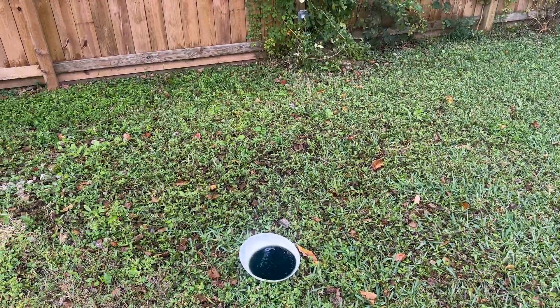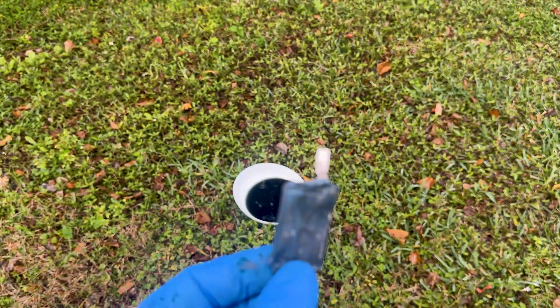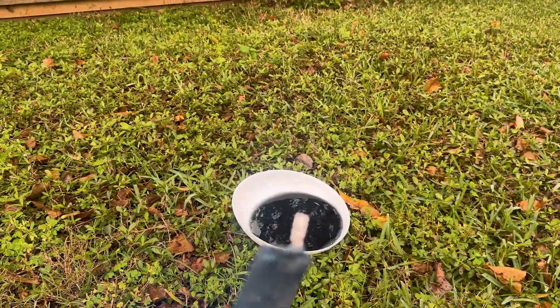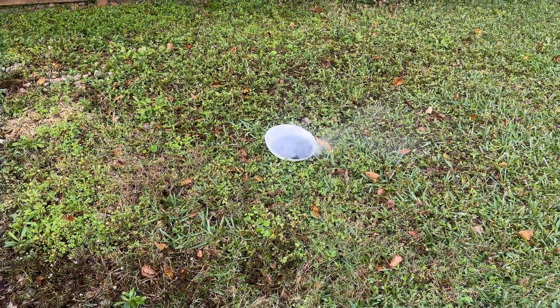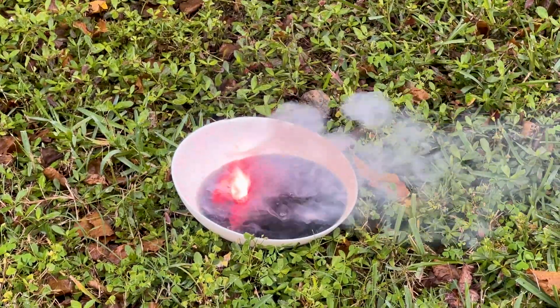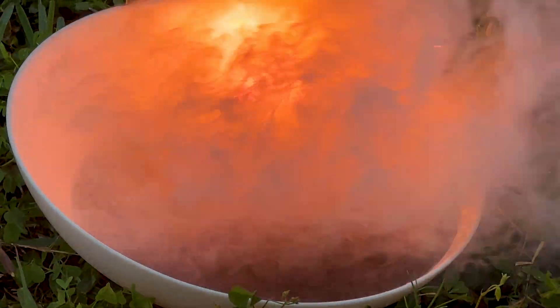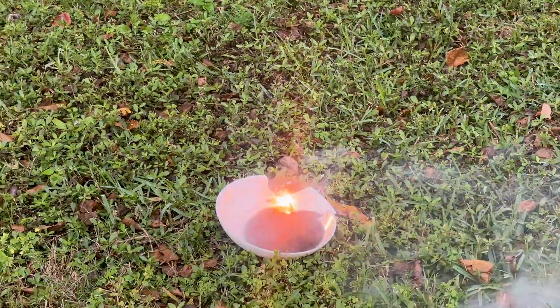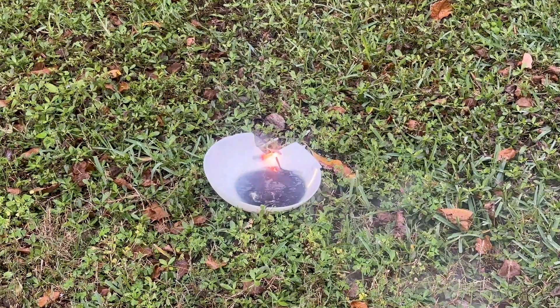Well, maybe not — I think I put the wrong piece of metal in there. I think this is the actual lithium, so let's give this one more shot. Three, two, one — oh yeah! Well, not quite explosive but we definitely have a reaction. It's getting a little hotter. Oh, it broke my bowl — that definitely took some heat.